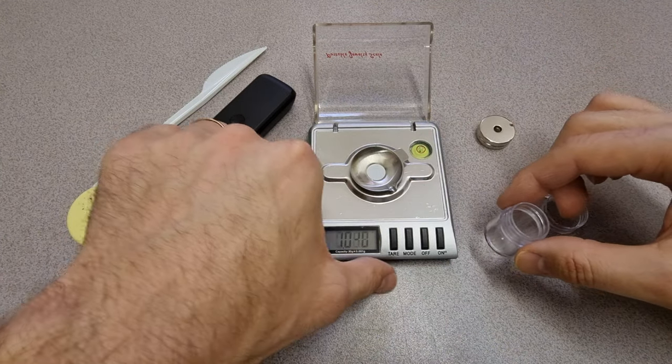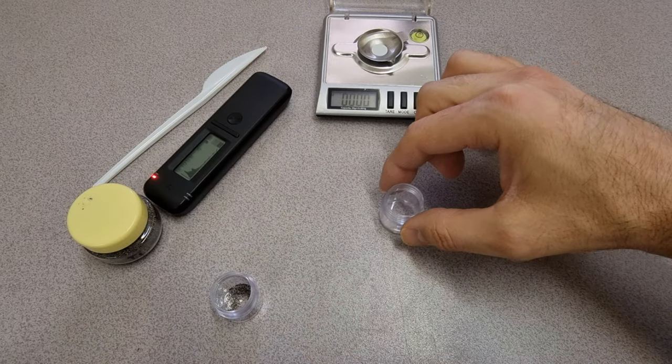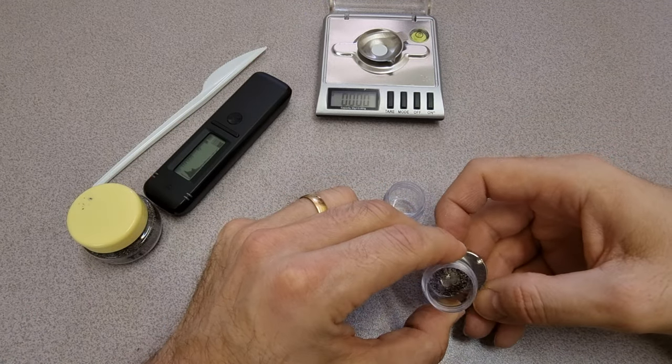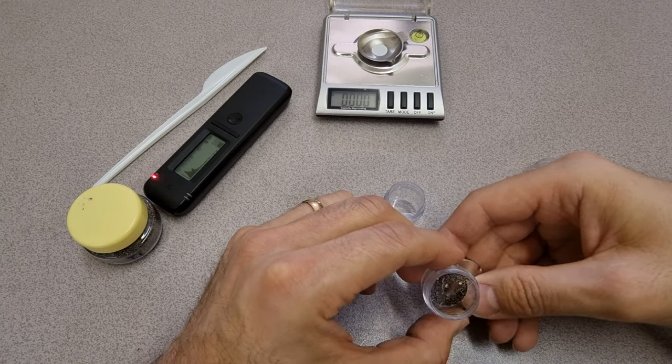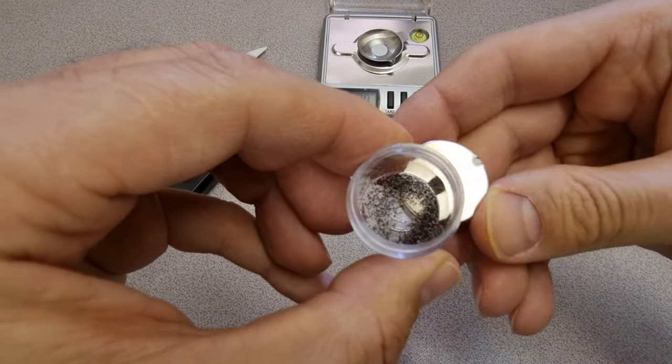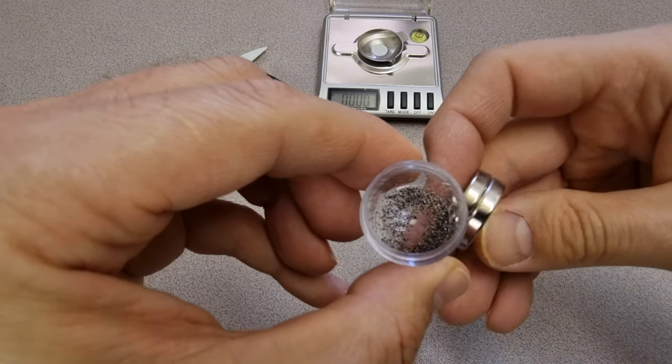We'll see if we can do some sort of magnetic holding here. I don't know whether it's going to be enough to go through that glass. It's just not that magnetic. I don't know if you can see that, but there doesn't seem to be a lot of movement in there.